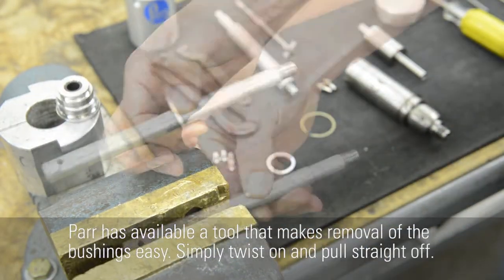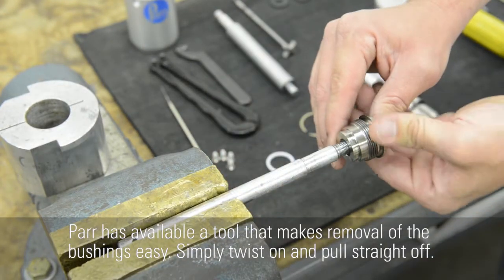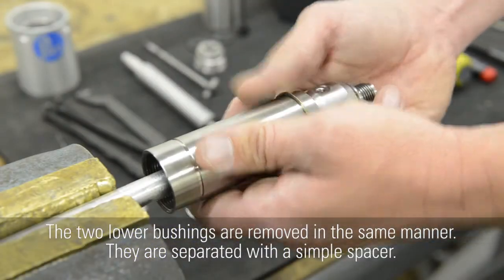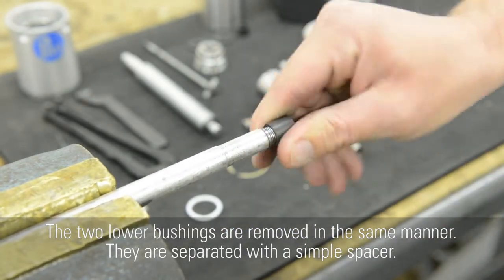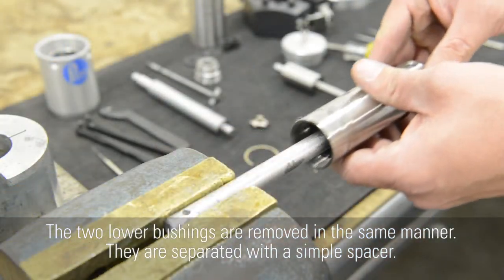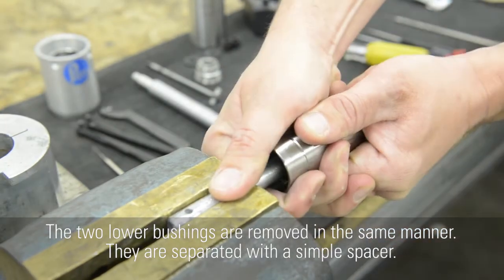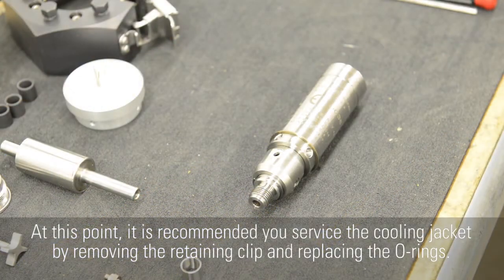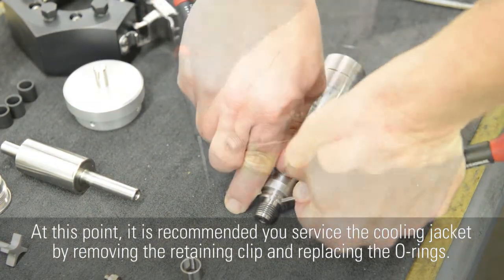Parr has available a tool that makes removal of the bushings easy. Simply twist on and pull straight off. The 2 lower bushings are removed in the same manner. They are separated with a simple spacer. At this point, it is recommended you service the cooling jacket by removing the retaining clip and replacing the O-rings.